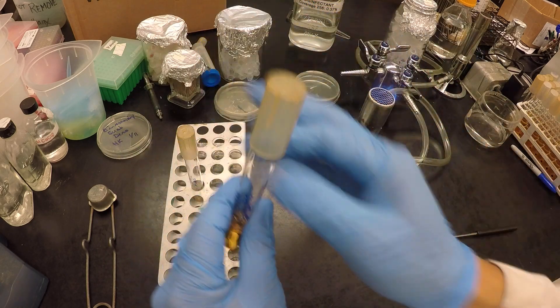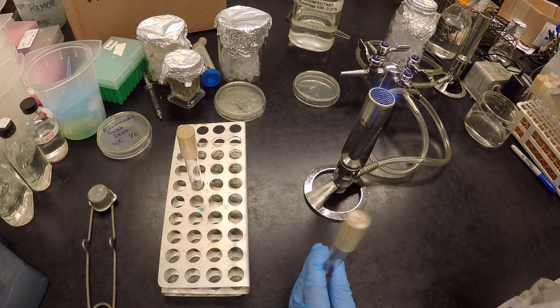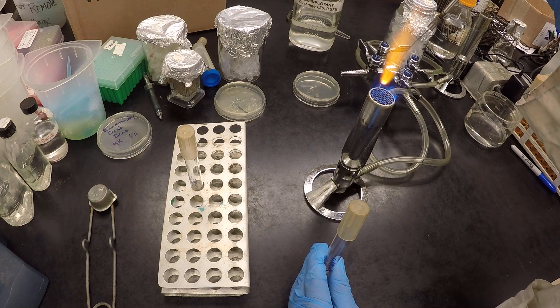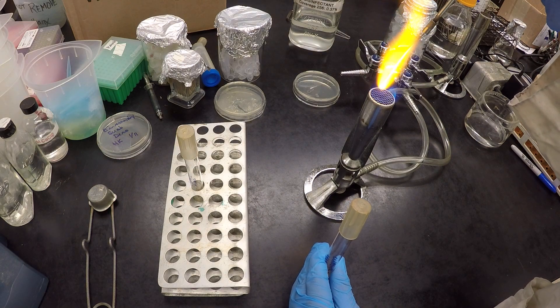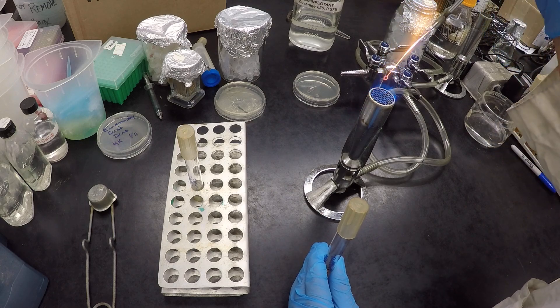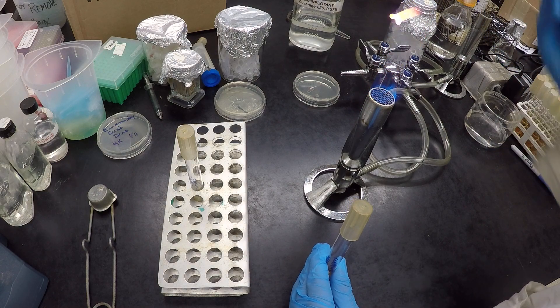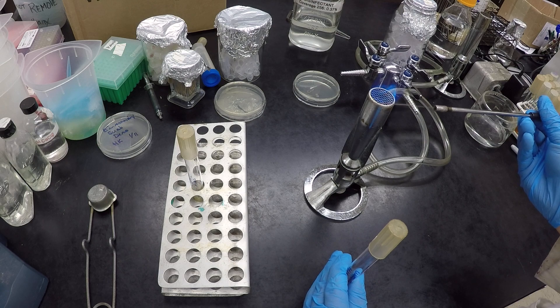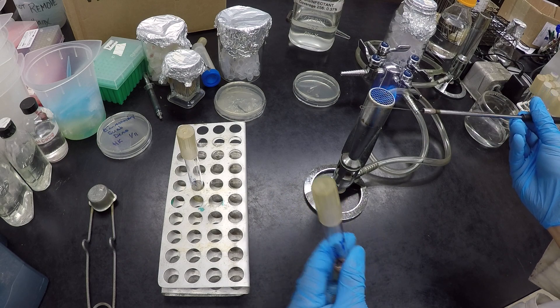So we mix our broth culture, then we sterilize our tool, like we've seen before. Nice and hot. I like to get the whole wire, let it cool. And then while I'm cooling, I want to take stock of what I'm going to do.